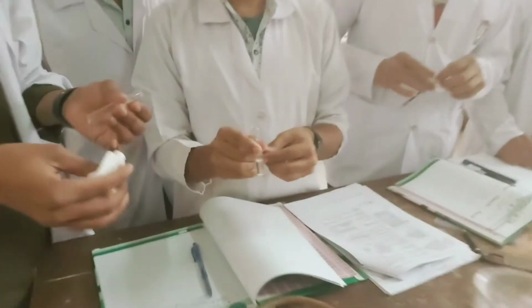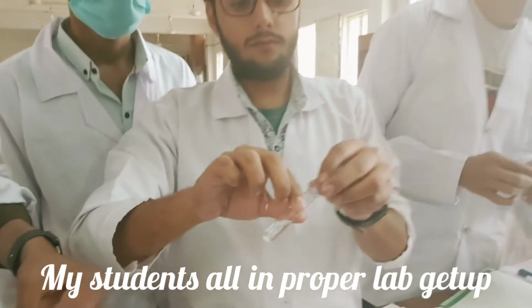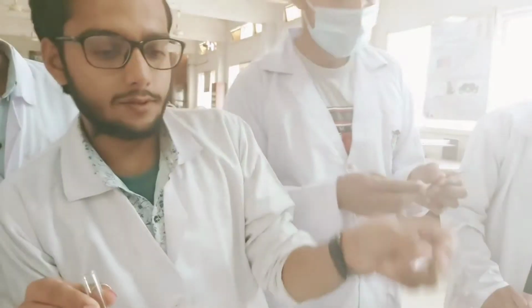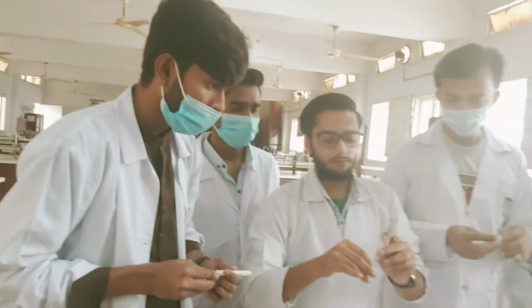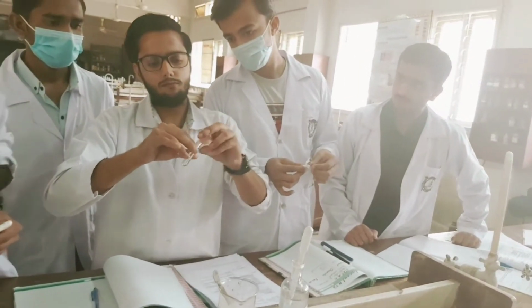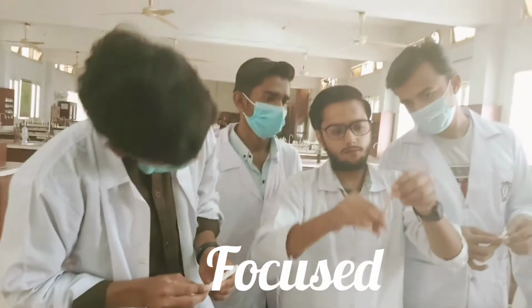So you are doing which test right now? The litmus test. So be quick, because you have done it before, you know how to do it. Blue turns to red. Now use another one. Okay, we are using the red litmus paper. Great, that's great. Do it. This shows it's acidic in nature because blue turns to red.